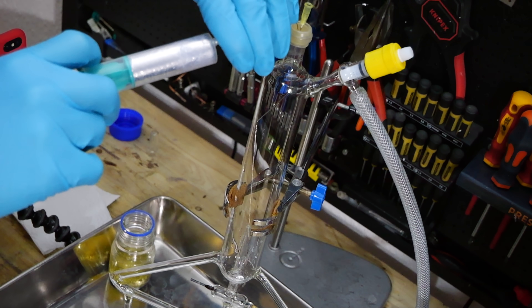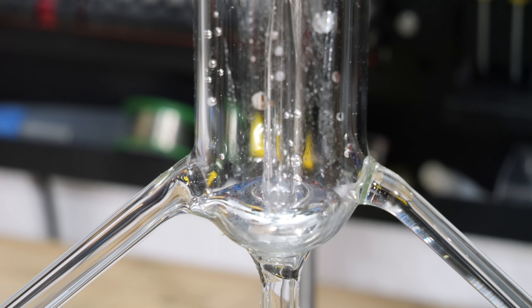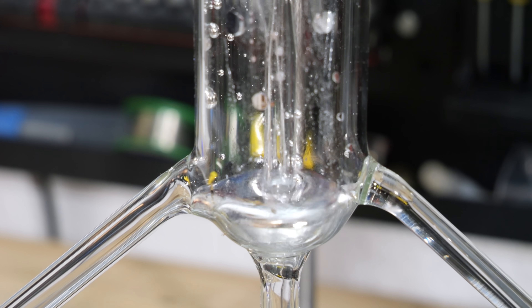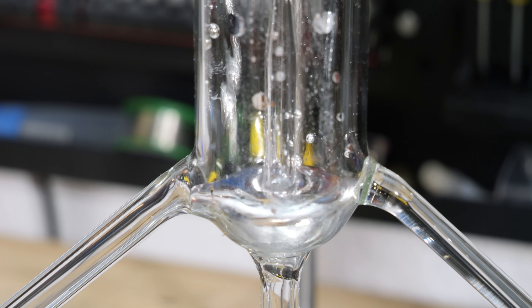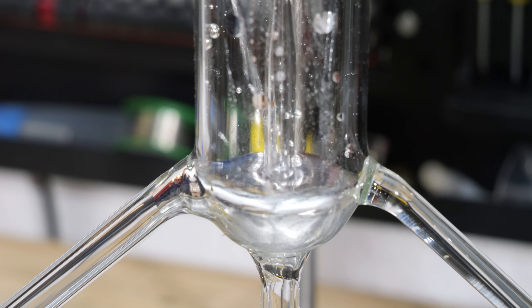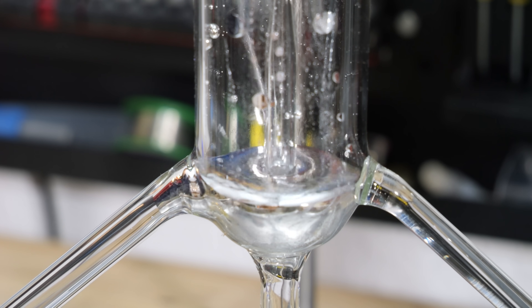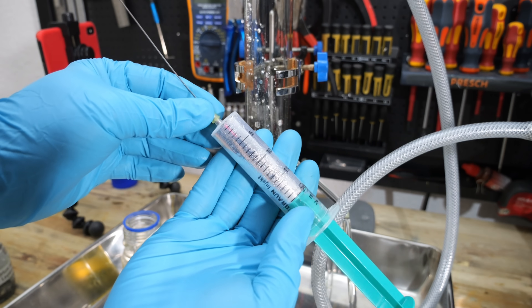And I'm quite dissatisfied with the process. As you can see, some mineral oil ended up in the fountain, causing the walls to look dirty. Unfortunately, it's currently my only way to fill the fountain without the metal oxidizing significantly. A glove box would be the most convenient, but even a good Schlenk setup would suffice. However, at the moment I don't have the space for either.